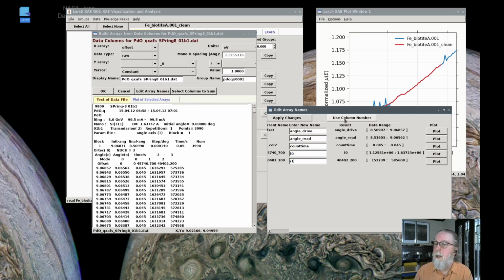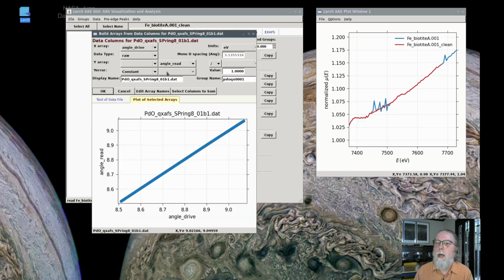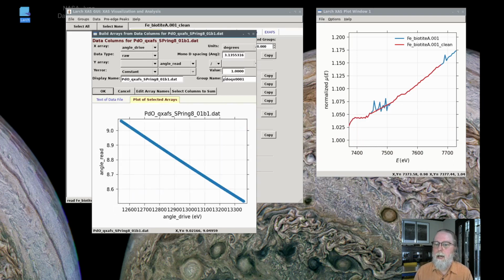We could also say use column numbers to just give column 1, 2, 3, 4, 5. For now, let's just do this. I think these are right for this data set. And now we can tell this that the angle is not in units of eV, but in units of degrees, and that we'll try to convert that, and it will also select that this is XAFS data.